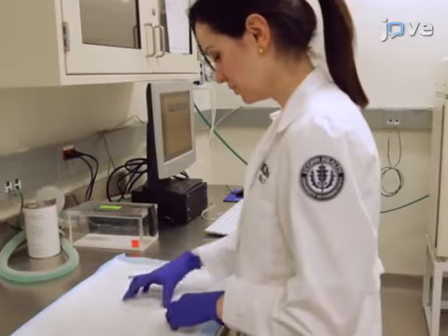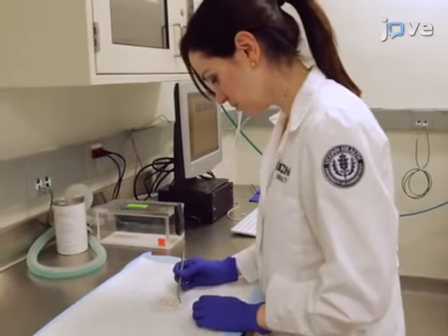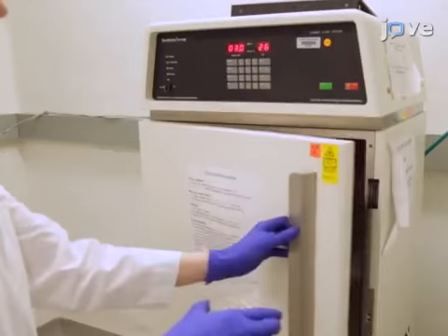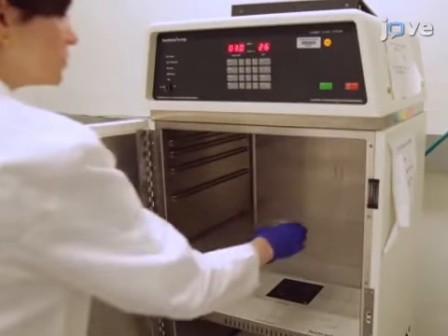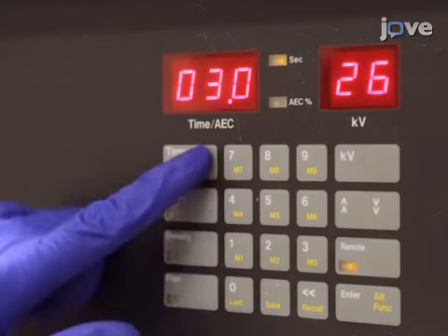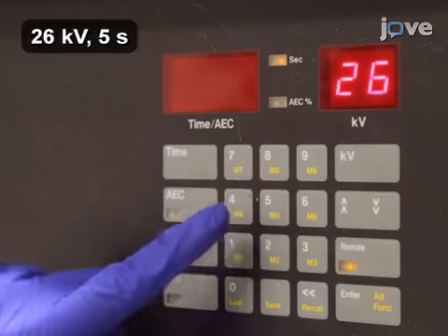For this protocol, have isolated, dissected mouse mandibles ready for use. On a petri dish, transfer the mandibles into an X-ray cabinet system. Then, take radiographs at 26 kilovolts for 5 seconds.